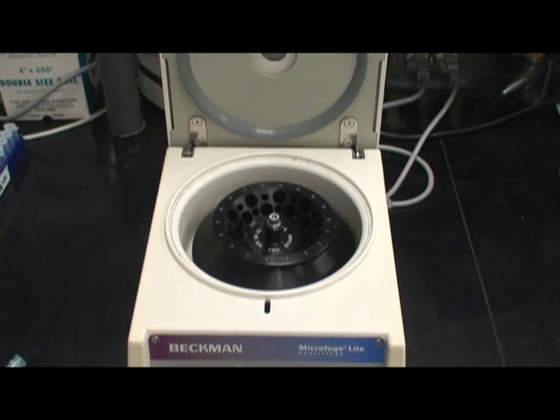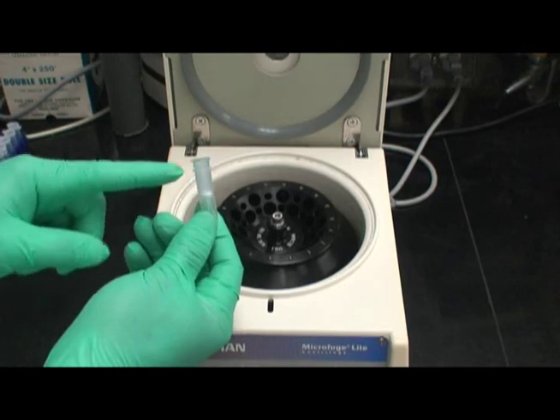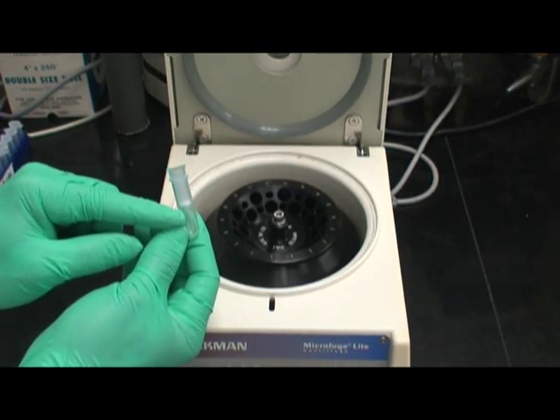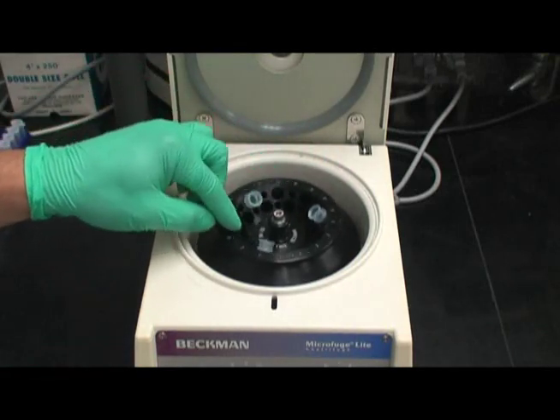Some rotors are also capable of spinning QIA spin prep columns. However, these must also be counterbalanced with identical tubes. In this case, three tubes are needed for proper balancing.